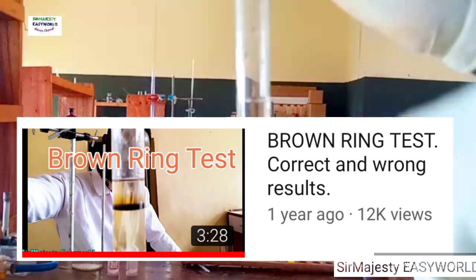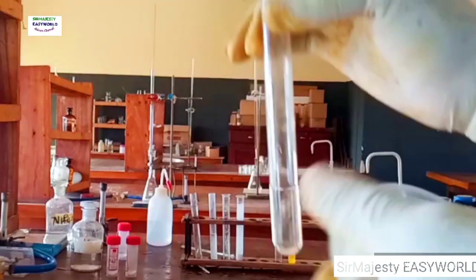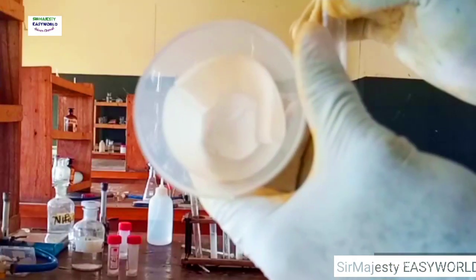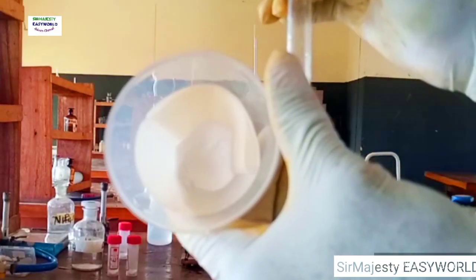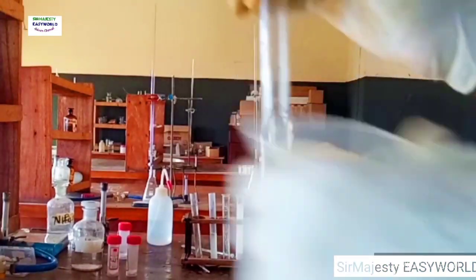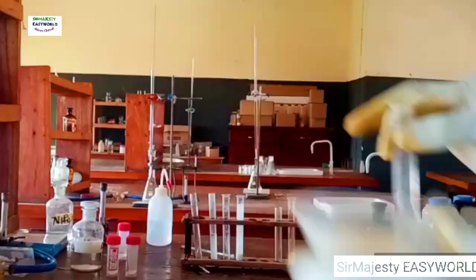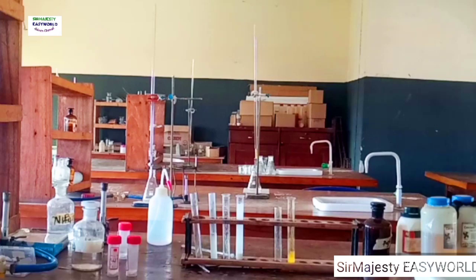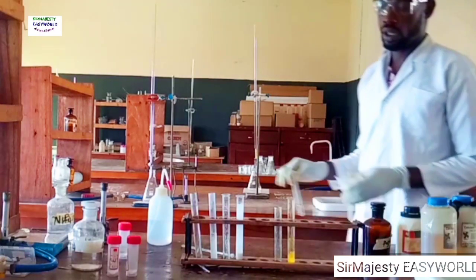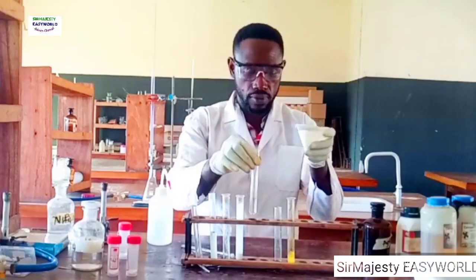here on this channel. So what might be told to confirm here, this filtrate now is calcium nitrate and this residue is lead(II) chloride, and we started from calcium chloride and lead nitrate. There will be exchange of radicals, such that what we have now is calcium nitrate, and here is our lead(II) chloride. So that's it for this particular mixture of salts, or these two salts being analyzed tentatively or collectively.